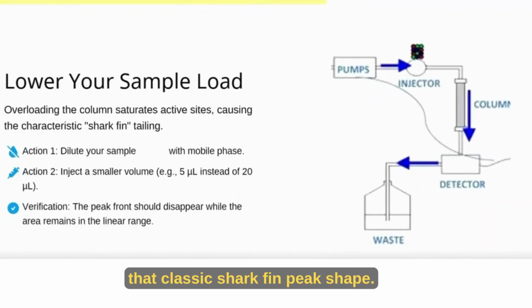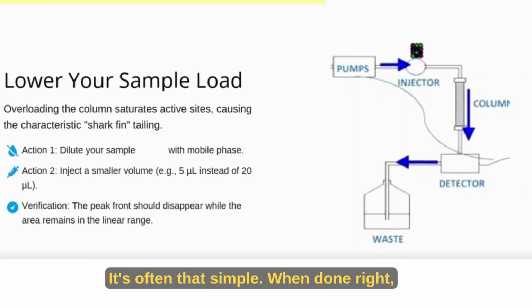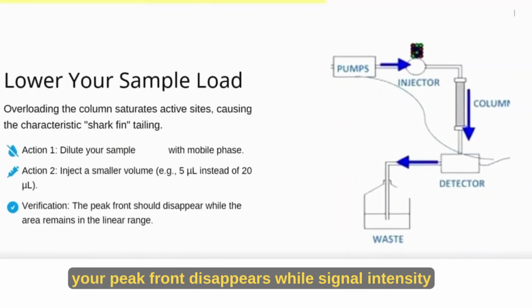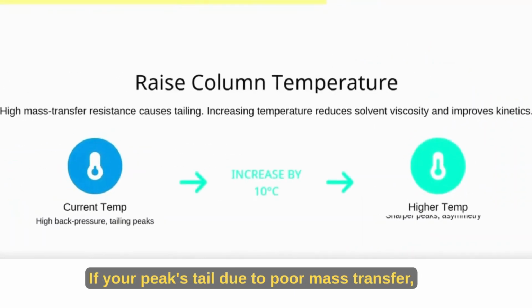Lower sample load. Overloading the column creates that classic shark fin peak shape. Try diluting your sample or reducing injection volume. It's often that simple. When done right, your peak front disappears while signal intensity stays consistent.